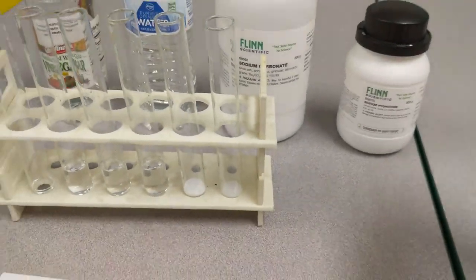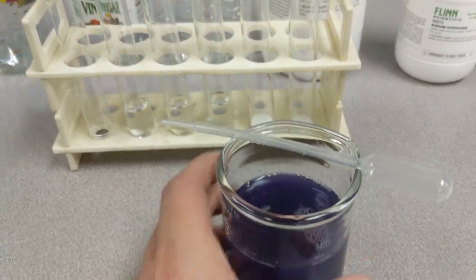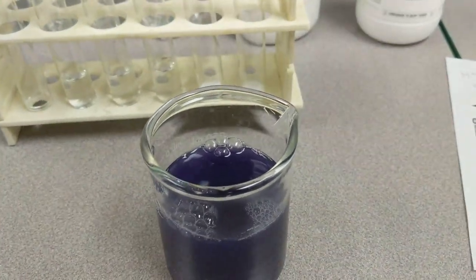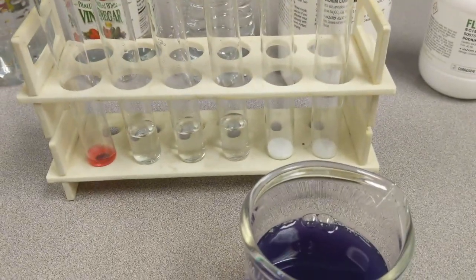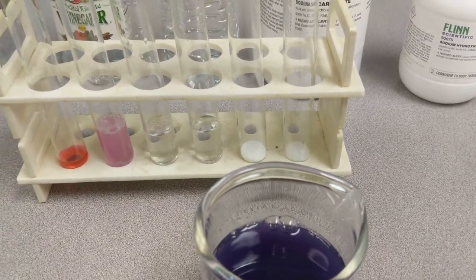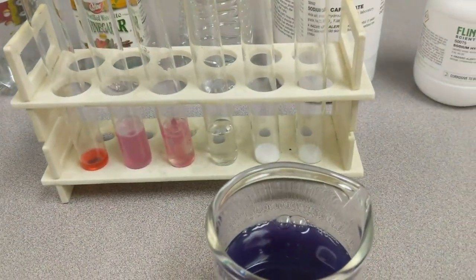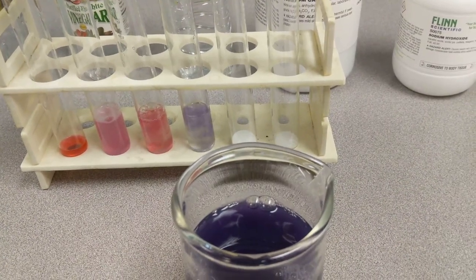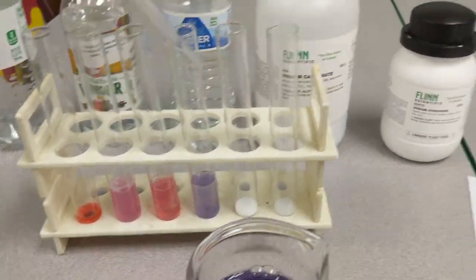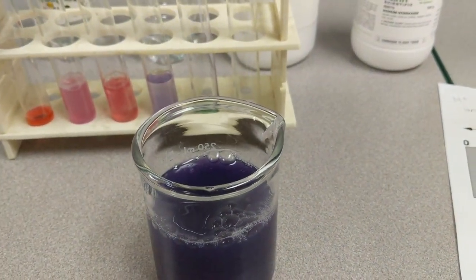What I'm going to do is take this anthocyanin and put a few droplets in each of the test tubes. You'll already see that the color is starting to change depending on where I'm dropping it. As a good baseline, this one here is the water — you'll notice that's a neutral pH of 7, so it pretty much has the same color as the anthocyanin itself.